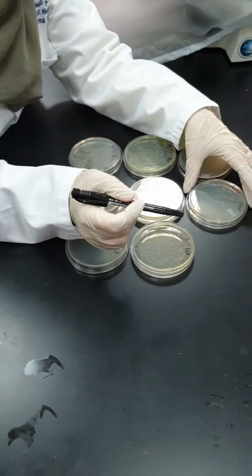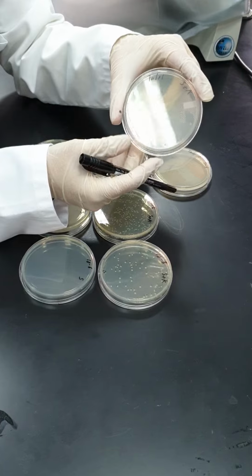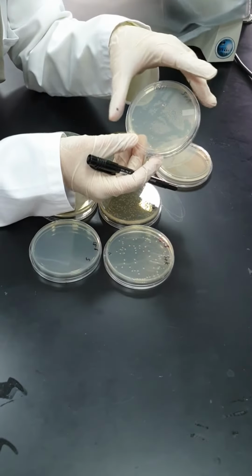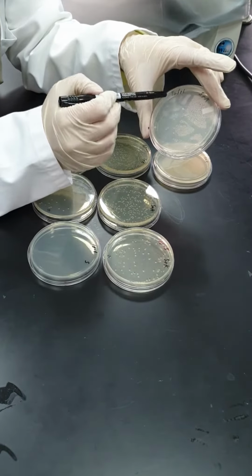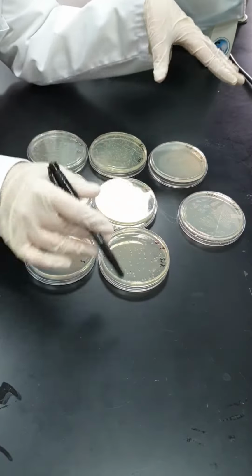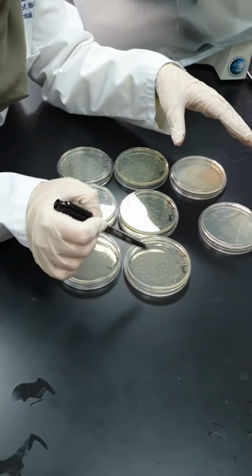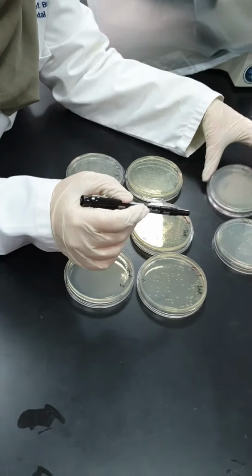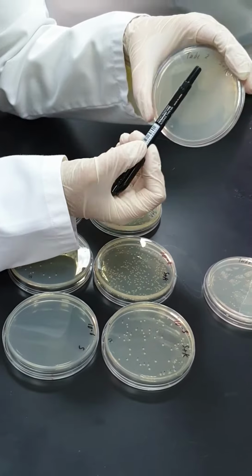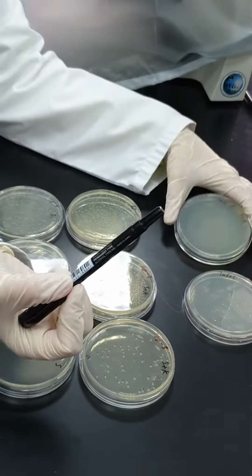After 24 hours of incubation, as you can see, we have nothing grown on tube 1, which is expected. This was the donor alone, which does not grow on streptomycin plus kanamycin. Of course, if multiple groups are working in the same lab, we always have to label our petri dishes with our names and with the date. Tube 2, which is the recipient, also has nothing grown on streptomycin plus kanamycin.